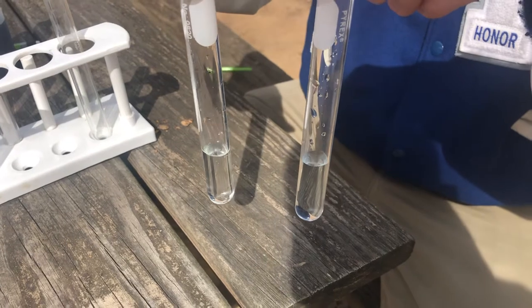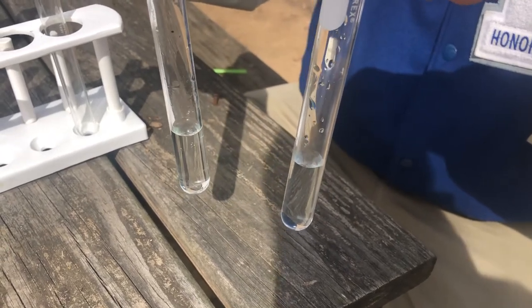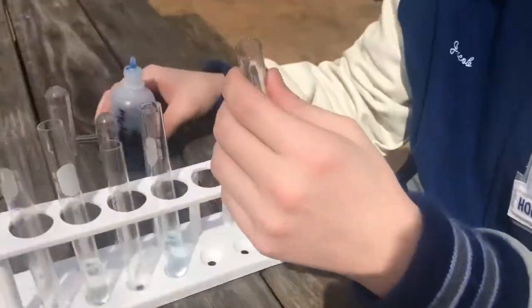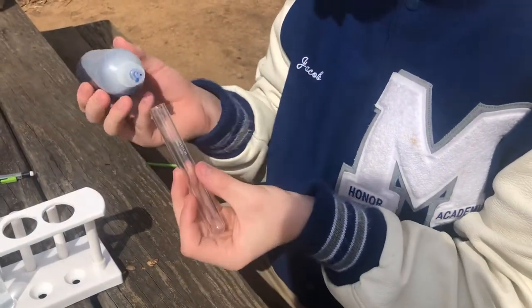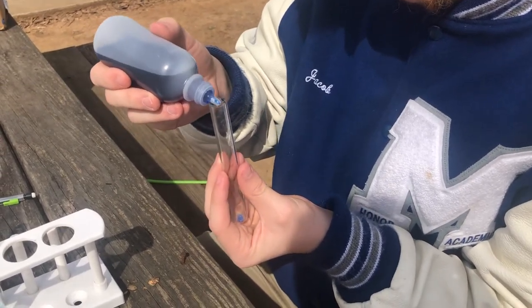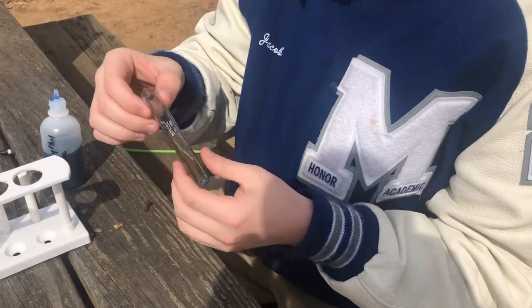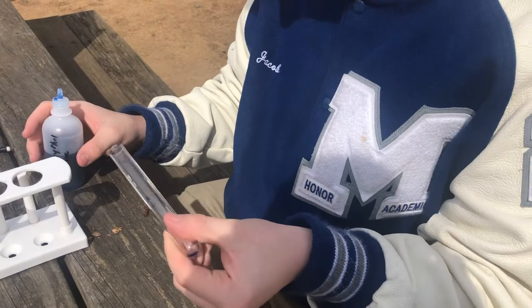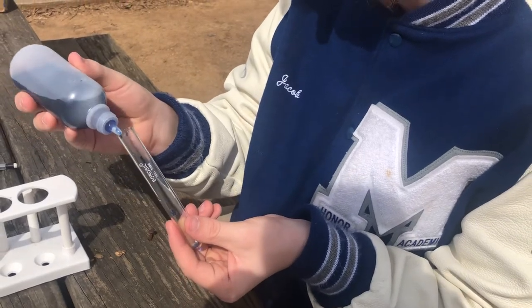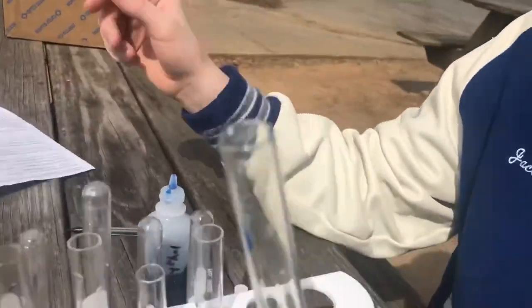We don't start calling it acid rain until the pH is below 5. We're now going to look at a second experiment, and we're going to use pollution to make our rain acidic. Grab a clean test tube and add a couple of drops of bromthymol blue — we have our acid-base indicator. We're going to swirl that around to coat the surface of the test tube with the bromthymol blue. You'll notice the drops are blue, with some drops at each end of the test tube.